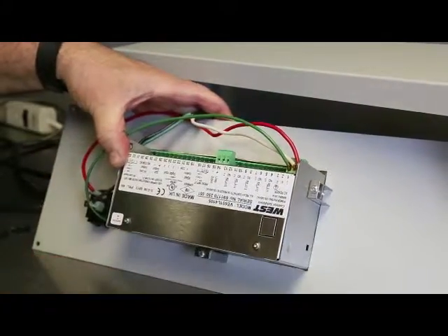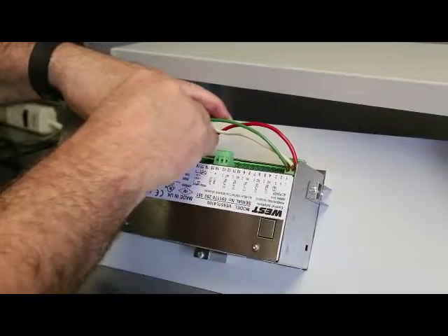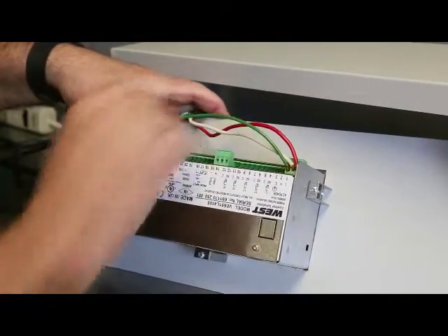Follow the wiring diagram on page 17 of the Protocol 3 manual to connect the wiring harness into the proper location.